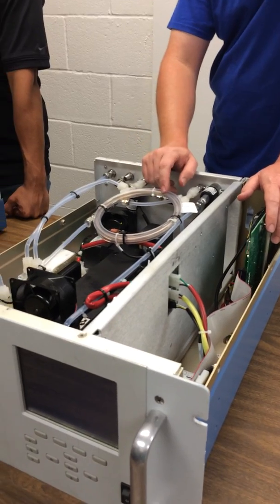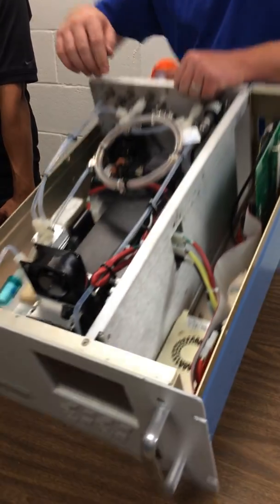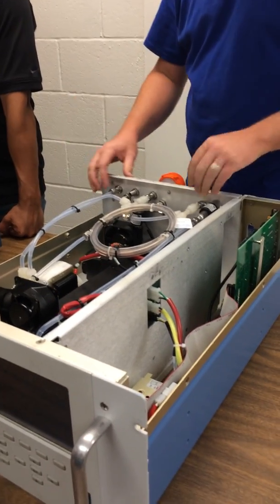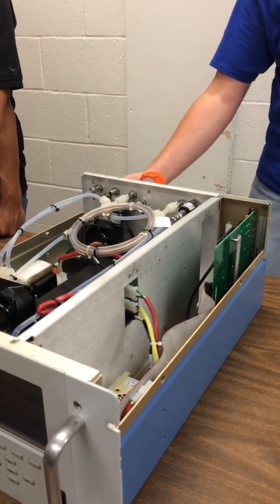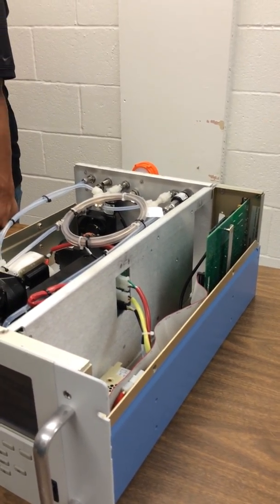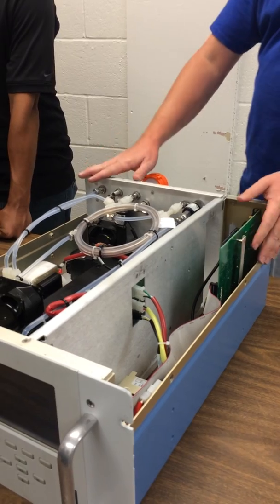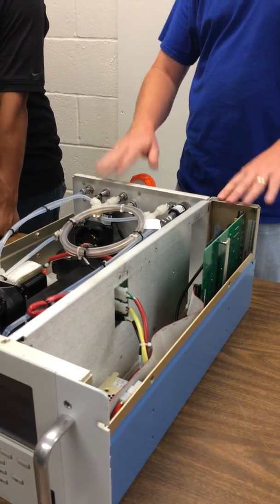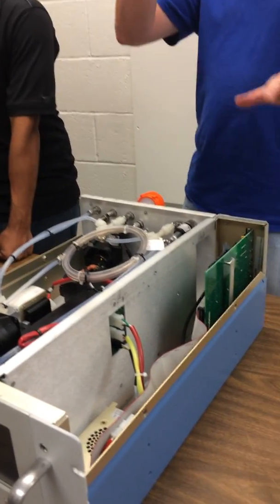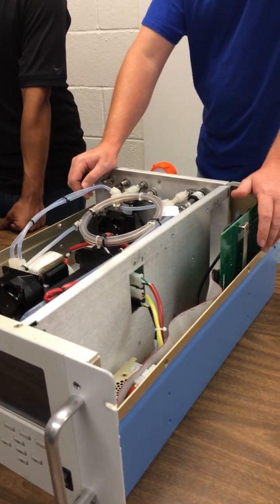The other thing that this instrument will do, this is a trace level enhanced. There's a block here along the side. This is heated. If you notice, this has cooling fans and everything in it. This fan actually takes air out rather than blowing it in. The lid is insulated. It's a thermal measurement. It needs to be at a fairly constant temperature. When we're running it, if it's been up and running and everything's happy, it runs at 50 C. That way it's always heating. If we pop the lid off of it, the measurements start kind of walking all over the place because now we're changing the temperature plus the IR.